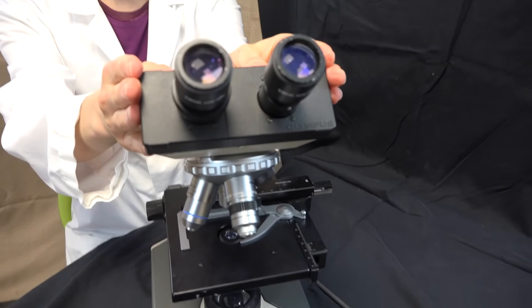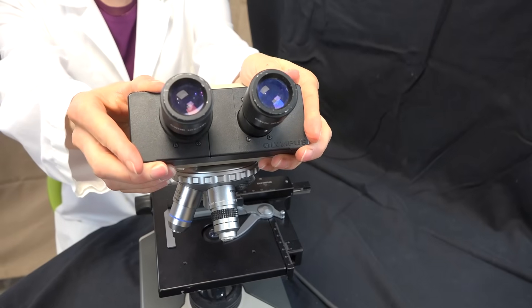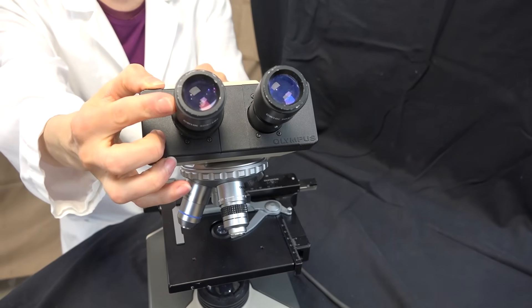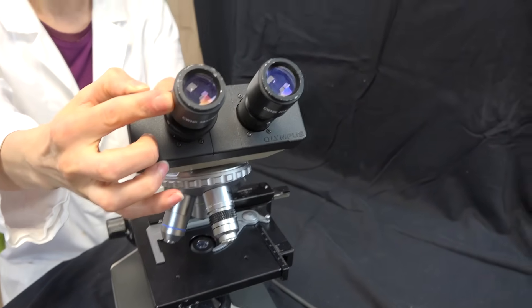At the top we have the oculars and they can be adjusted out and in to fit the width of your eye. The oculars have a magnification of 10x.